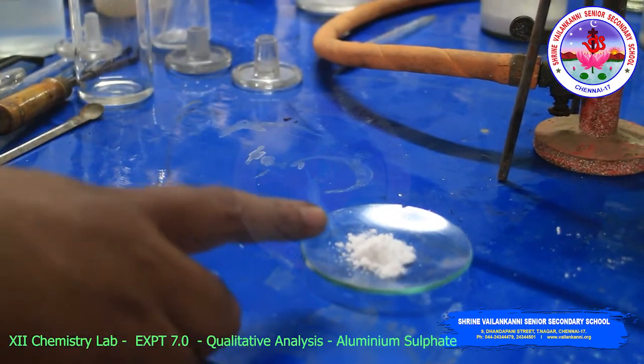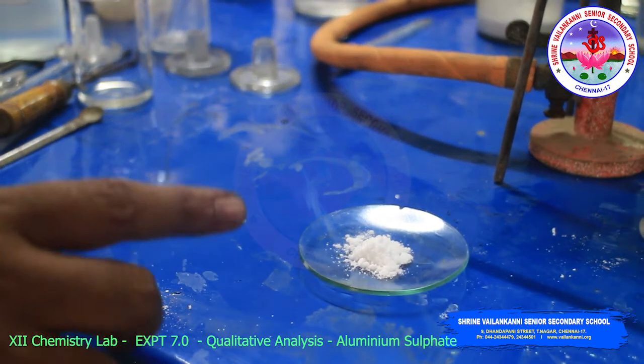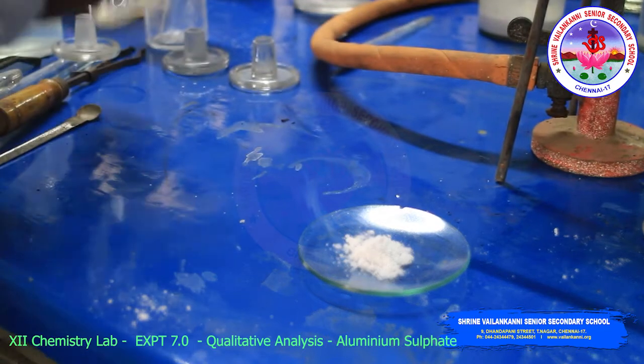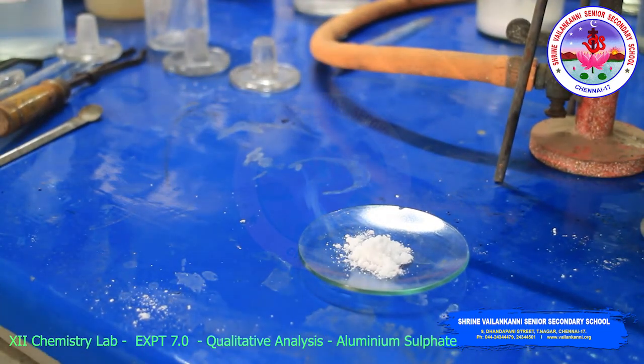Now we will do the experiment. The fifth salt, aluminum sulphate. We are going to do the aluminum sulphate test. First we have to prepare the sodium carbonate extract.